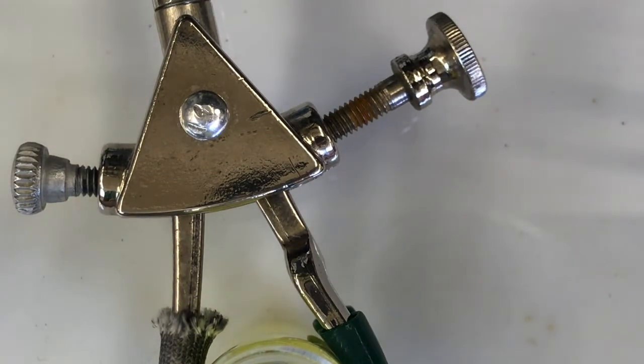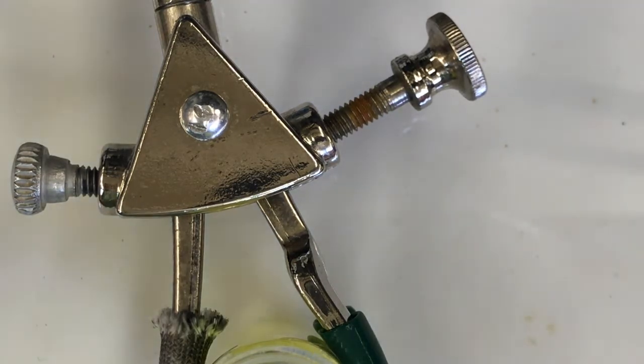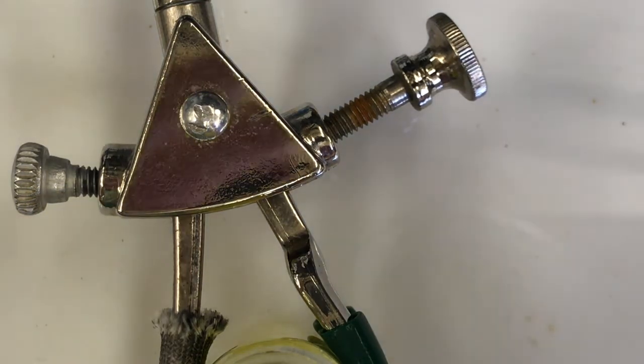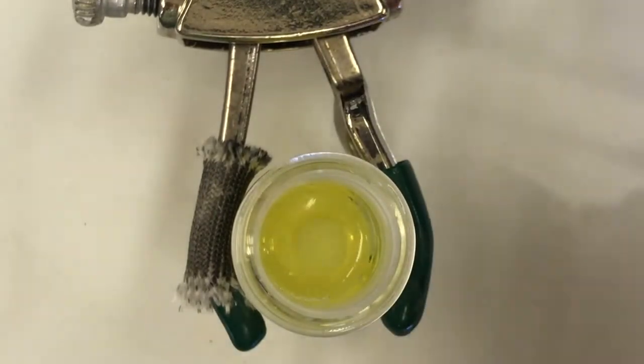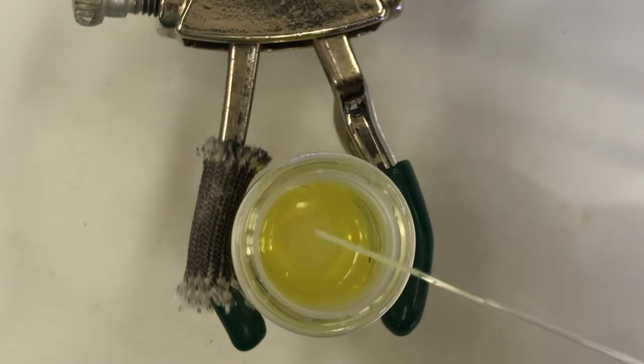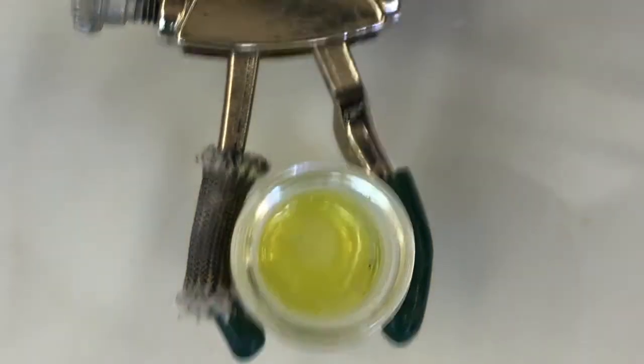So that first spot was 33 seconds. I'll write it on here. 33 seconds was the first one. And then let me just get another one, and I'll just tell you what time it says. And the 33, actually, I'm going to call that 34 because I started the timer a little late. So let's say 34 seconds, and then let me go back into my solution again. Draw some up. You can see it pretty good now, huh? The yellow. And then I'm going to bring my camera over this way to my TLC plate area.